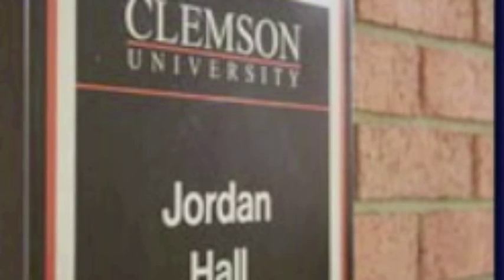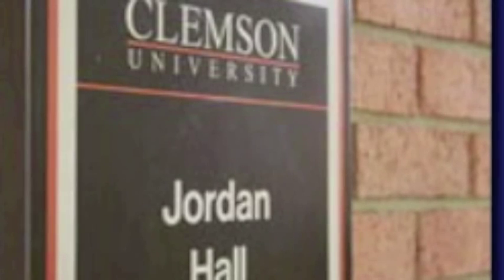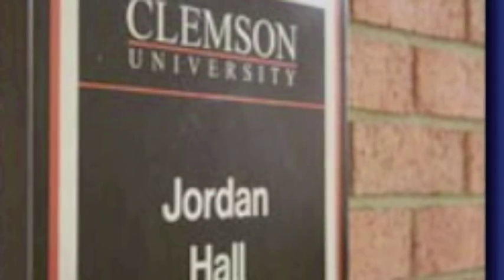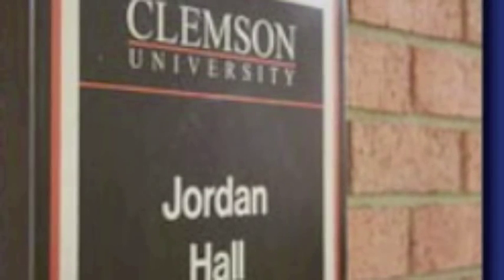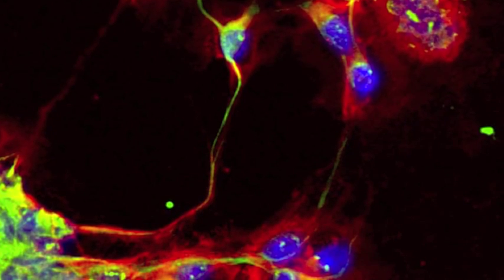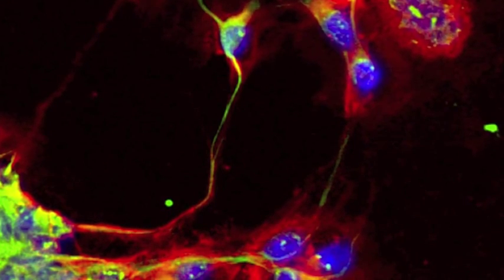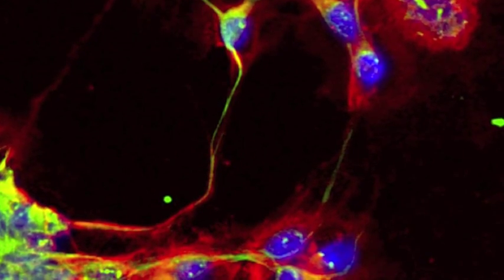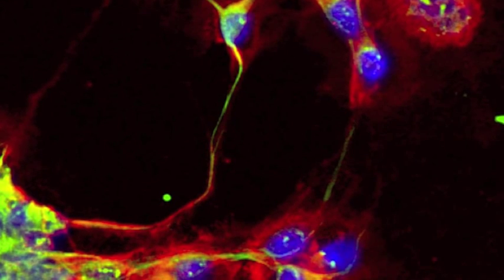Hi, I'm Dr. Terri Bruce. I'm the manager of the Jordan Hall Imaging Facility in the Biological Sciences Department at Clemson University. And today I just wanted to show you some options for staining cells.